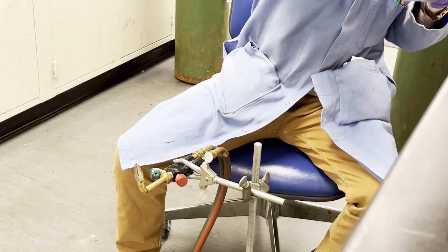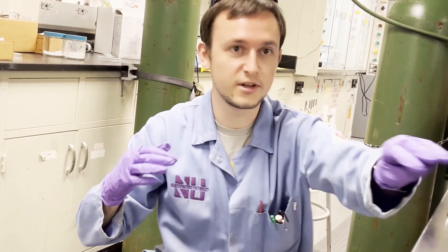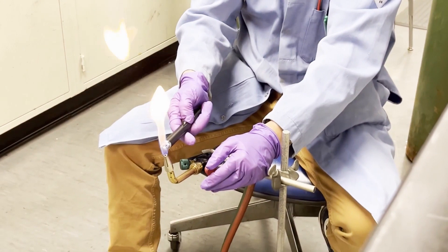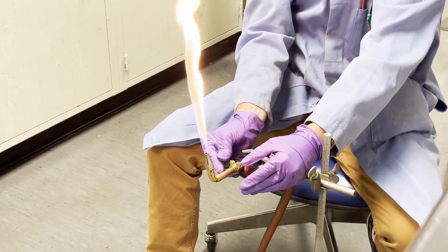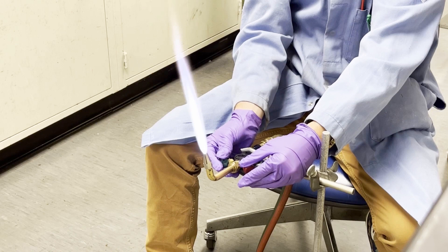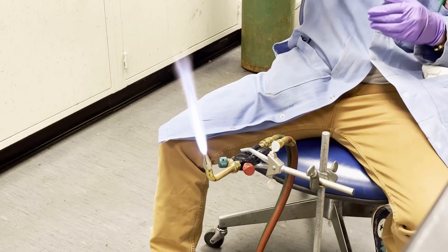The actual carbon coat itself is pretty straightforward. I'm going to switch my goggles out here. You don't need a really high flame because the acetone combusts at a pretty reasonable temperature. I like a pretty moderate amount of methane and a pretty quiet—just starting to hear the torch is probably a good temperature.